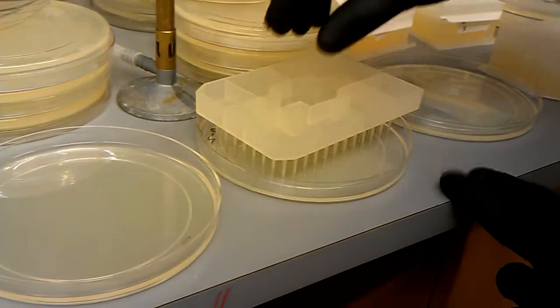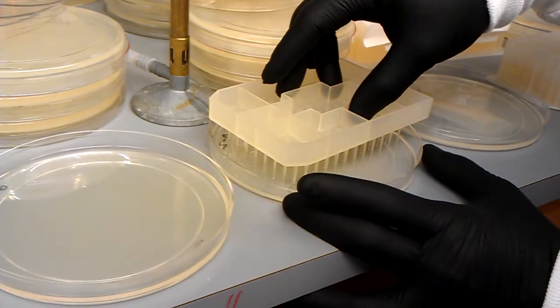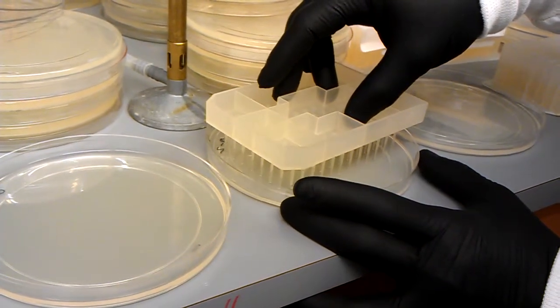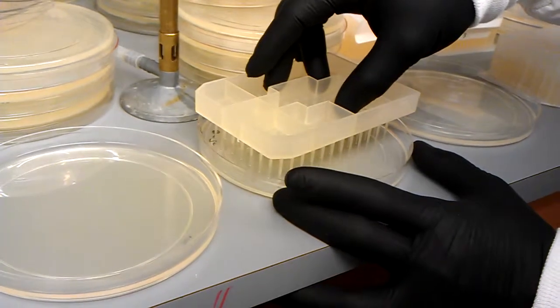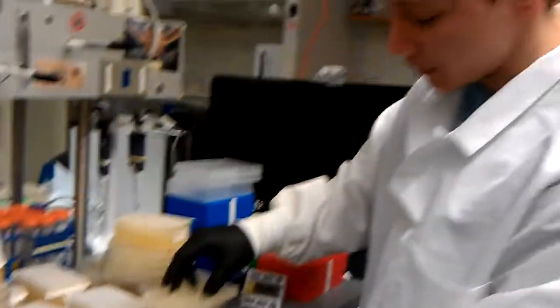If you want to get a slightly larger spot, you can very carefully make a little pattern, like a little squiggle. And that will spread out your signal a little bit more. And here's our last one.